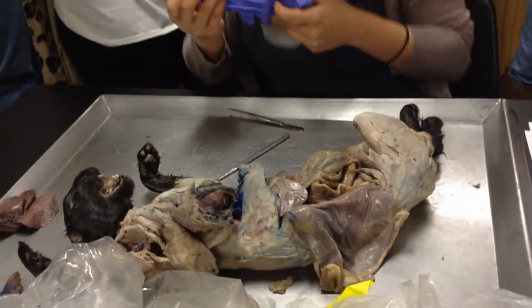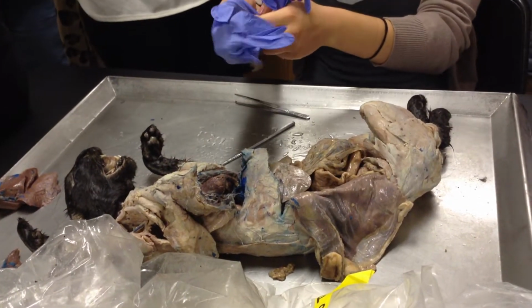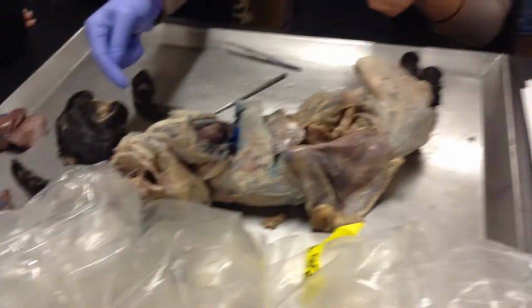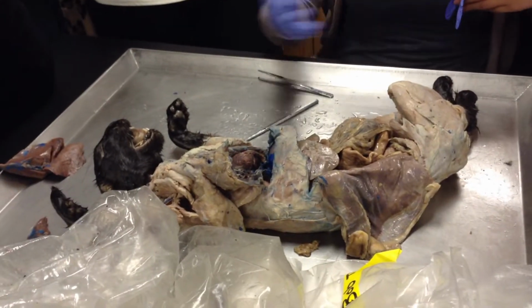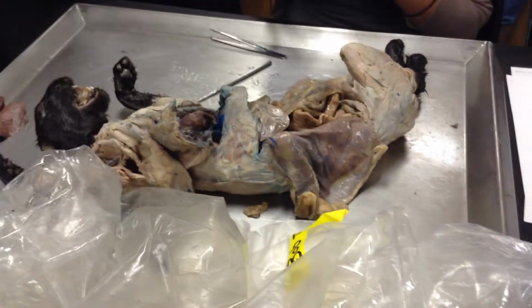So I'm going to go ahead and continue on with the digestive system. Notice the digestive system, starting from the mouth to the anus, is a long tube. With the different parts of the tube, we give it different names. Starting from the mouth, as it passes the throat and goes past the abdominal cavity, this long tube is the esophagus.